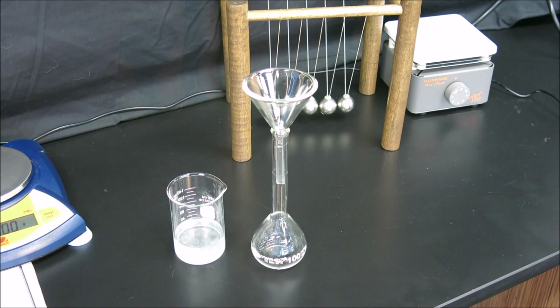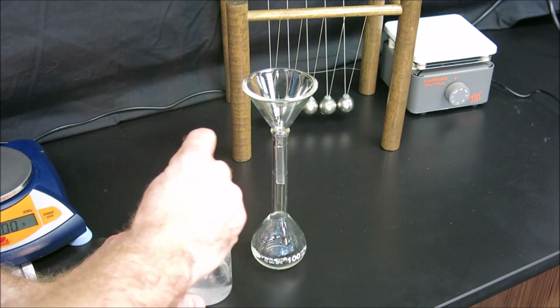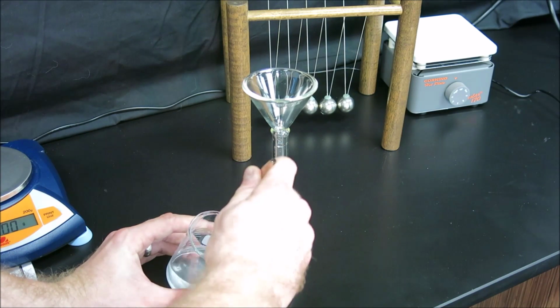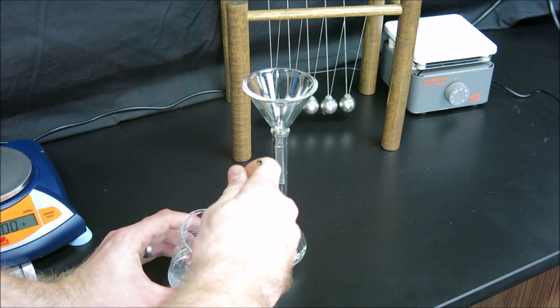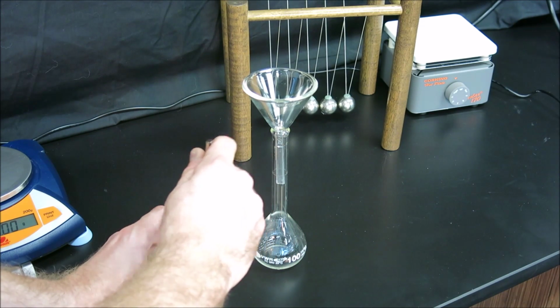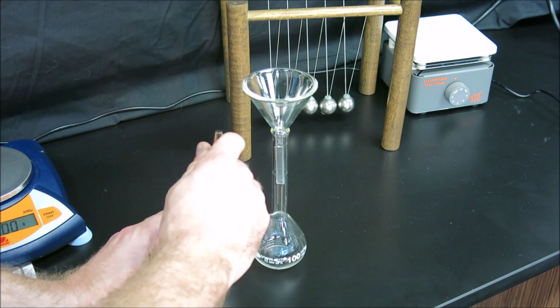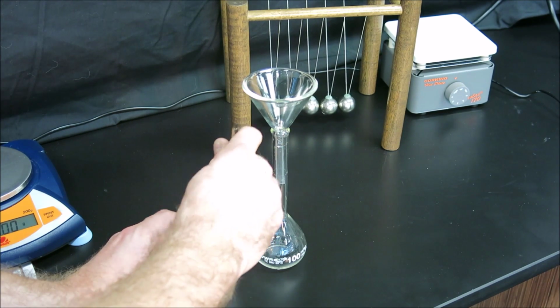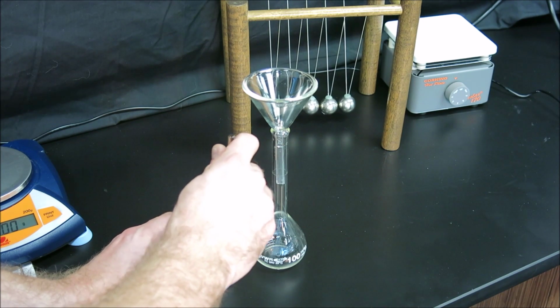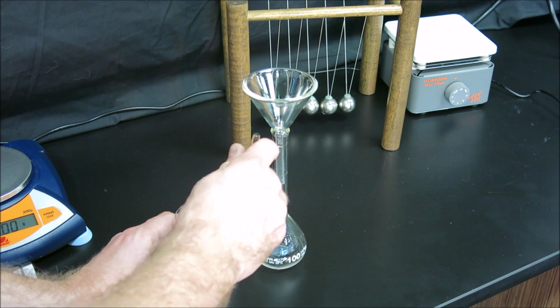So instead of just using water to begin the dissolving process here, the solution preparation, we're going to use 2 mole per liter sulfuric acid. And we're going to stir that up and make sure that the solid mostly dissolves as best as we can before beginning our transfer process into the volumetric flask. The iron 2 ammonium sulfate dissolves fairly readily, but a little bit of agitation and the warmth of my hand here will speed up the process.